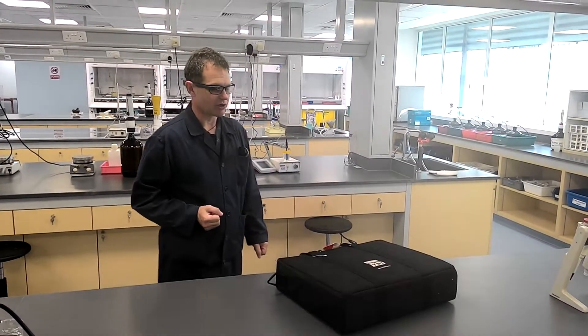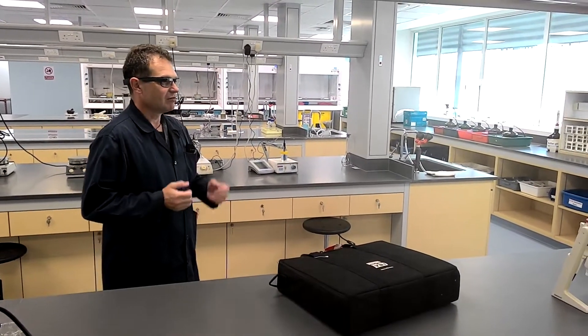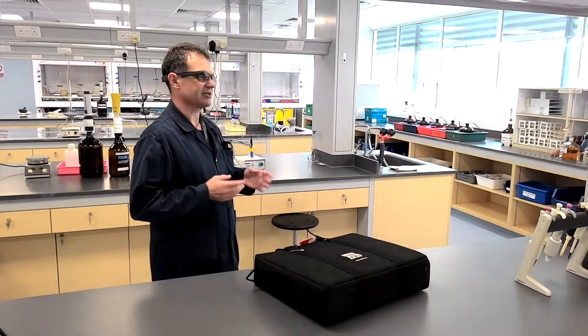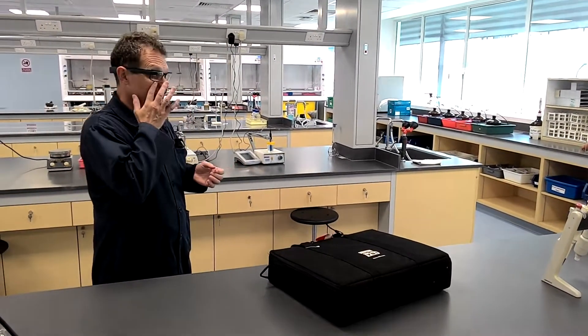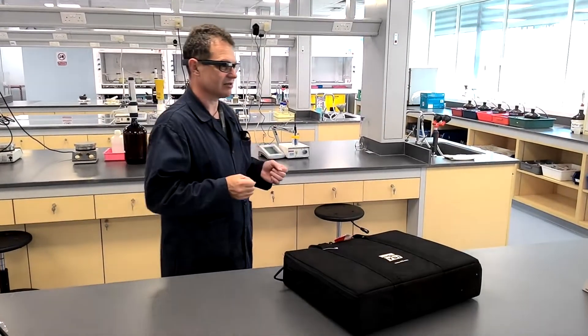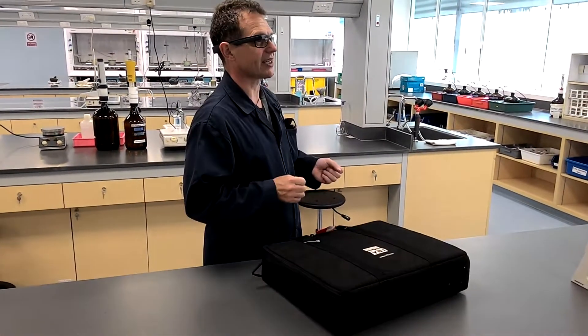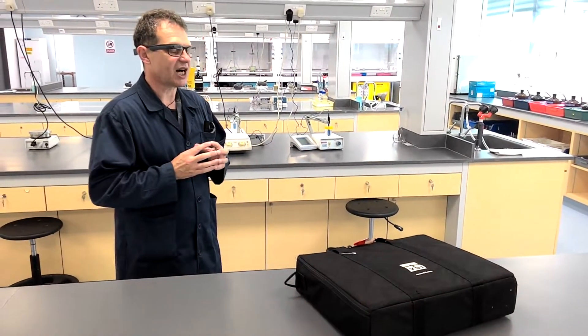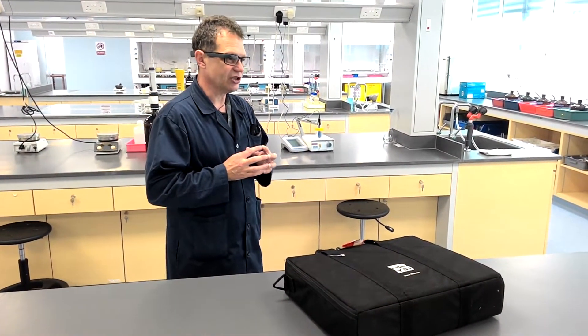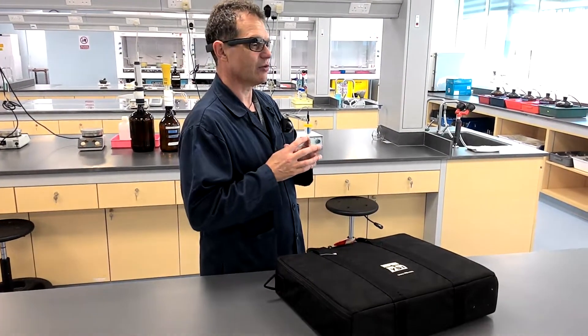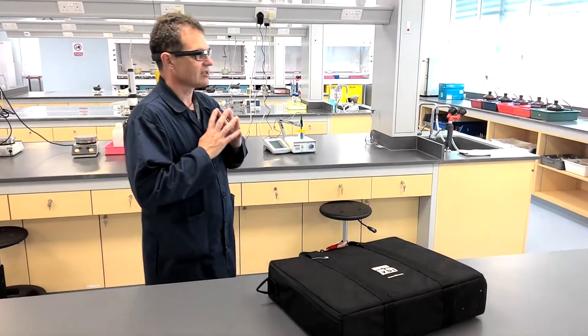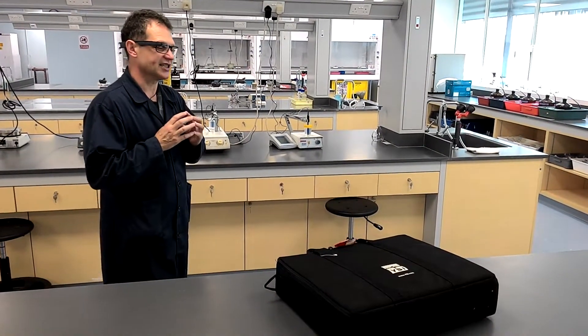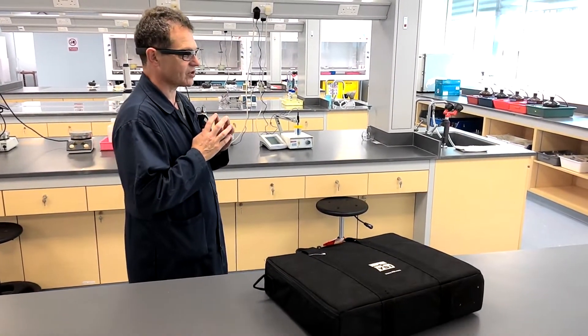At the moment we're in the laboratory. Now, most of the kits that we use, and the reason we use kits, be they chemistry kits or measurements actually at the riverbank, most of the time these kits are approximate and usually if you bring samples back to the laboratory you can determine what you're interested in much more accurately, much more precisely.